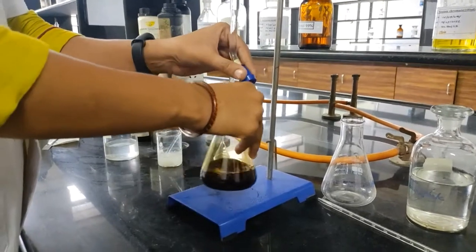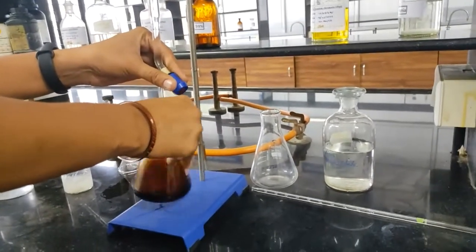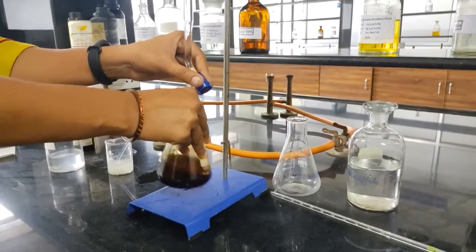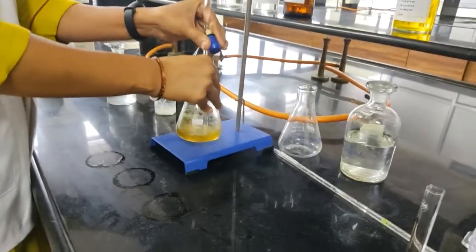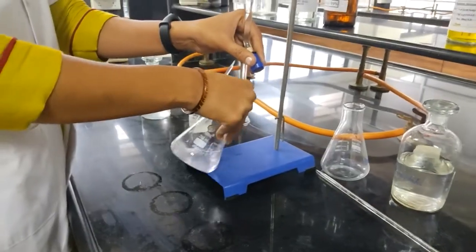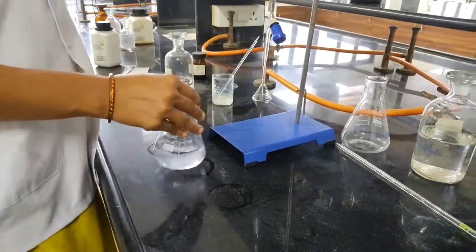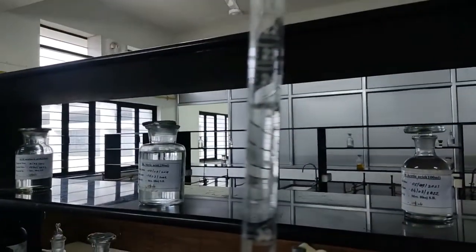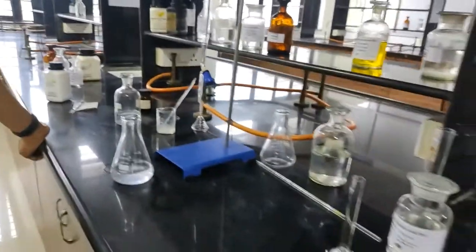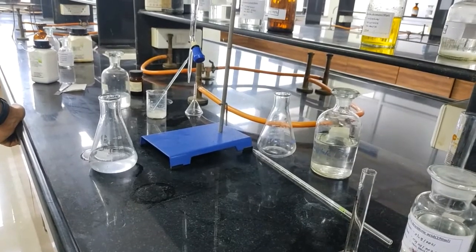Continue the titration until the blue color turns into colorless. The blue color changes to a white/colorless solution at the endpoint. The burette reading for standardization of 0.1 molar sodium thiosulfate is 24.5. Repeat this procedure 3 times and calculate the mean to determine the molarity of sodium thiosulfate.